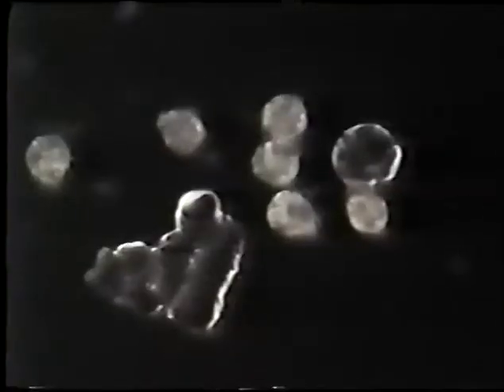This is prior to any exposure. The fellow had undergone surgery approximately 30 days earlier. He has facial and throat cancer. Actually had to lance this fellow 3 times to get any blood out of him. His blood was so clumped together like this. Needless to say, he complained about being cold a lot.